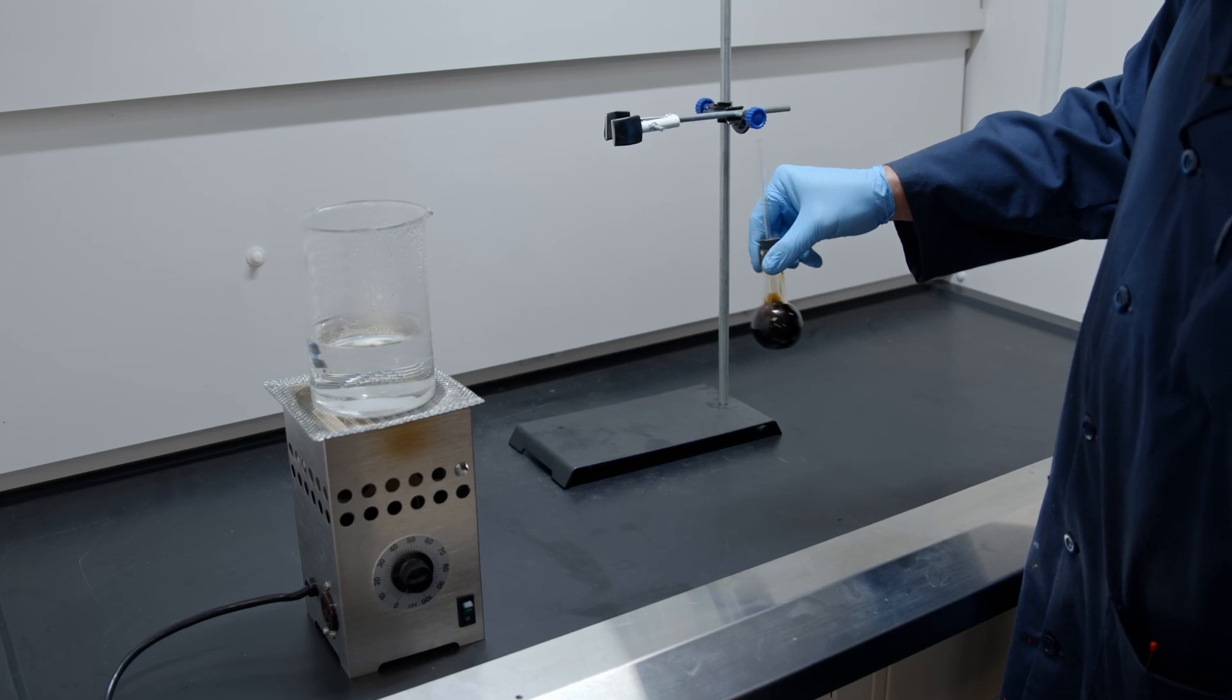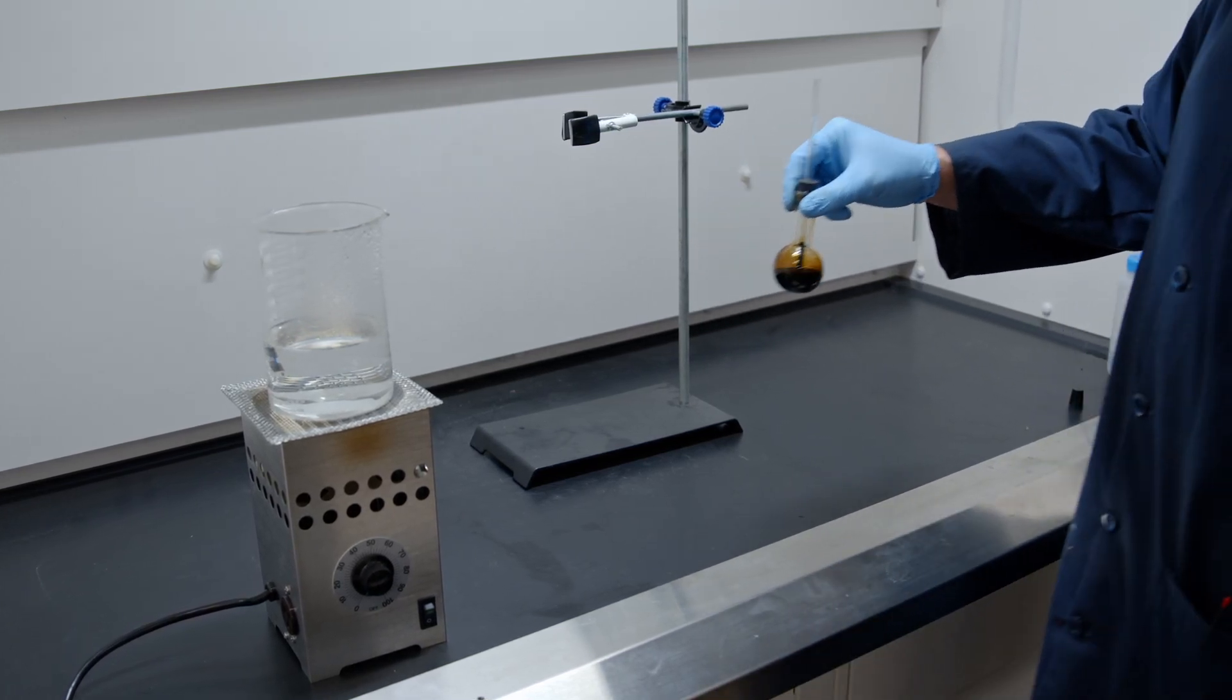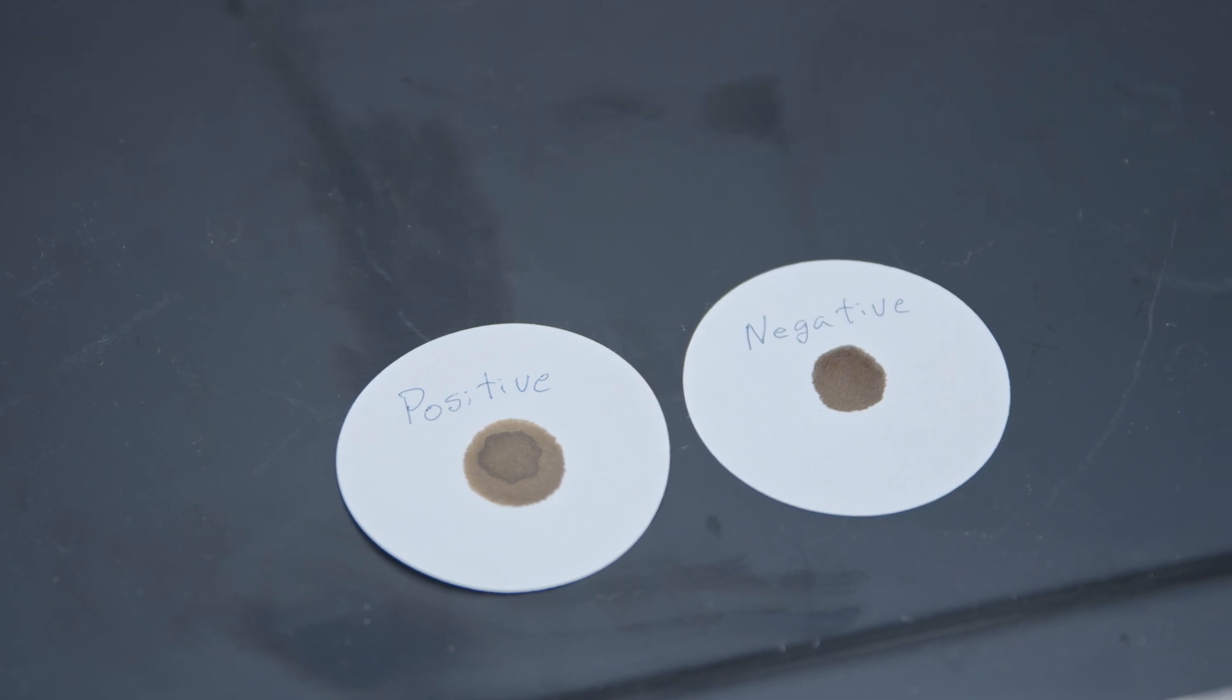Stir the sample vigorously until the sample is again dissolved in solution. Place a drop of the solution on the filter paper.